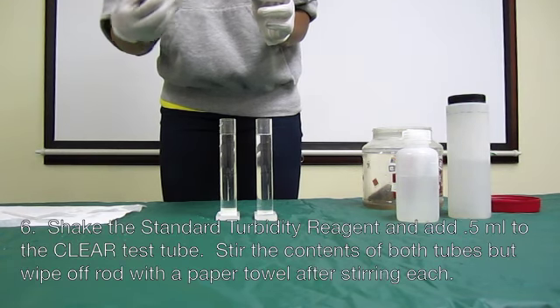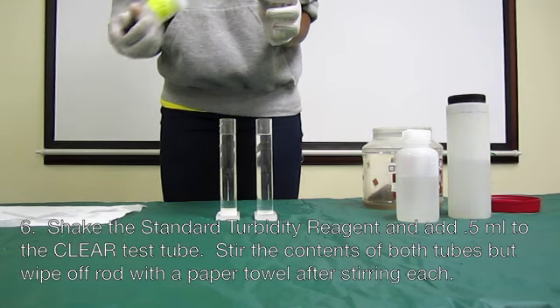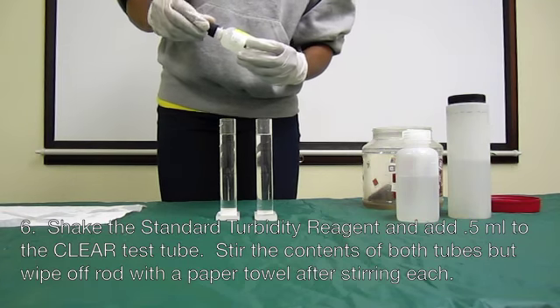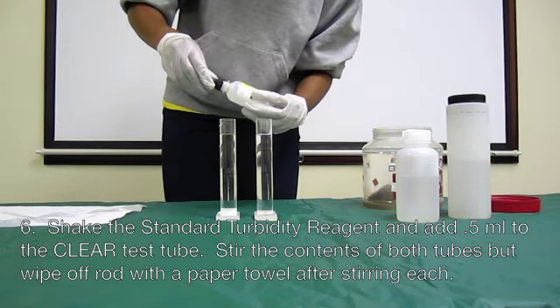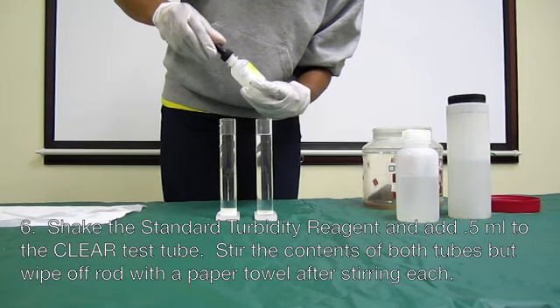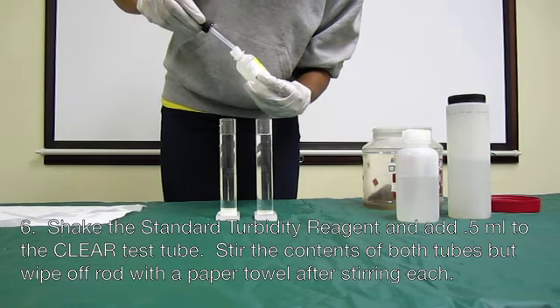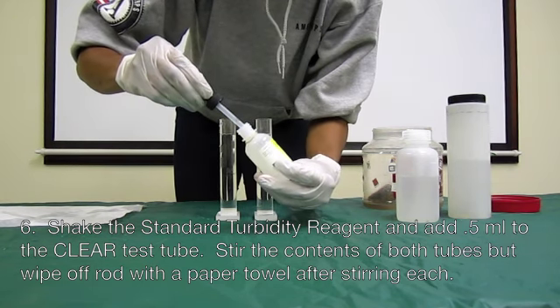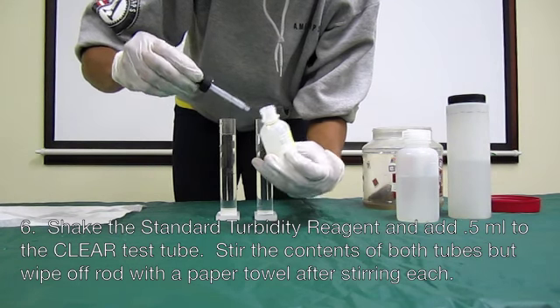Shake the standard turbidity reagent and add 0.5 milliliters to the clear water tube. Stir the contents of both tubes with the stirring rod to equally distribute turbid particles. Wipe off the rod with a paper towel after stirring contents of each tube to avoid cross-contamination of the tubes.